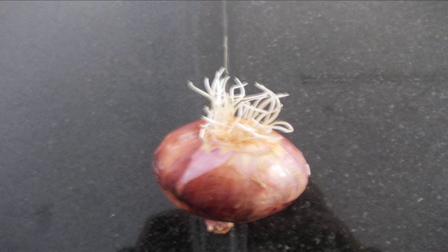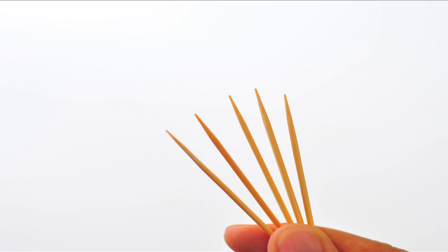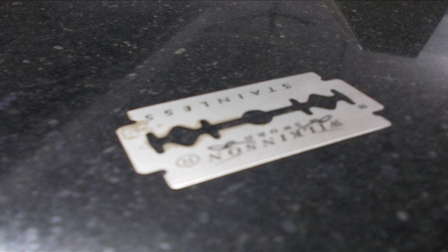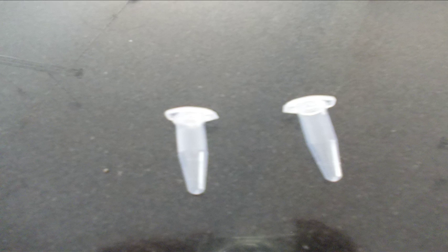An onion plant with a root, four to five toothpicks, scissors, forceps, razor blade, an Eppendorf tube.